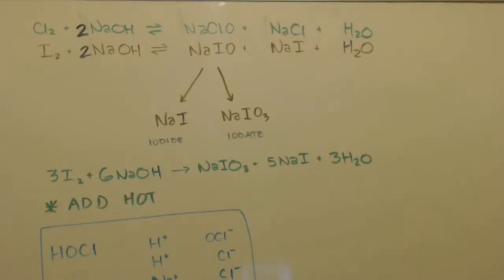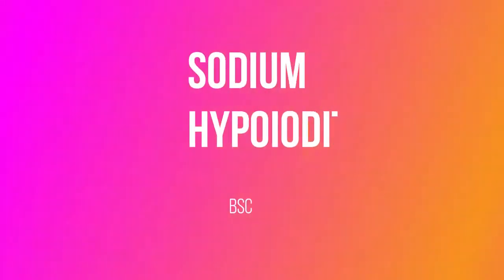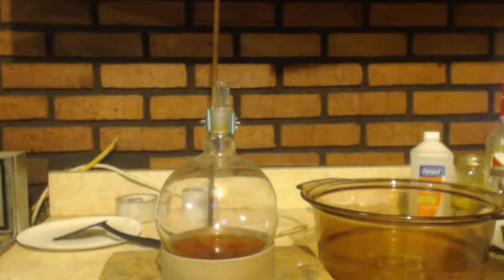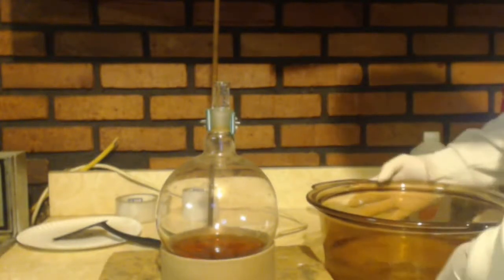That is the first clip that I will show, and that's where I get my stuff from. Still got that iodine water there. And here's where I was cleaning that. Remember the funnel? Now that water has sodium hydroxide in it. So basically that's making bleach. Not sodium hypochlorite, but sodium hypoiodite, which is just basically iodine bleach. So we're finally going to make the sodium hypoiodite.